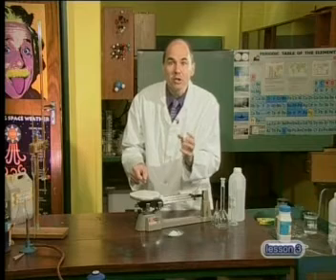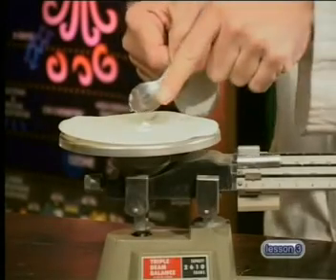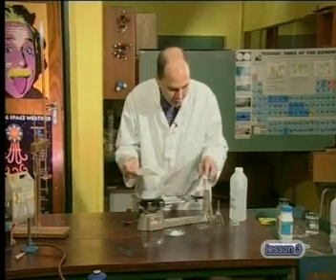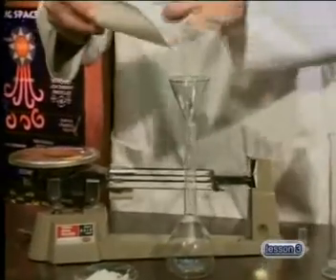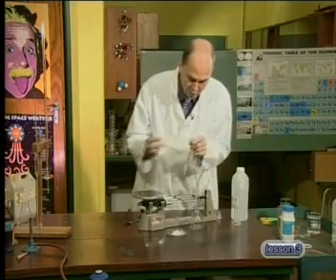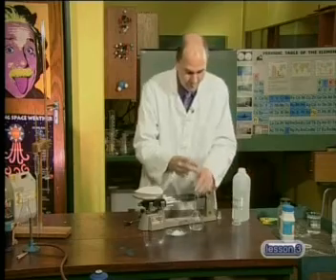Come and have a look at what I'm doing. I'm making a solution of sodium hydroxide, but I want to know what the concentration of the solution is, so I'm weighing out the solute. I'm weighing exactly 0.4 grams of sodium hydroxide. I'm then going to take this weighed sample and transfer it into this volumetric flask using a funnel, making sure that all the crystals go into the funnel. Now I'm going to wash the funnel down with some distilled water. Sodium hydroxide dissolves very easily, so I add just a little bit and then swirl.